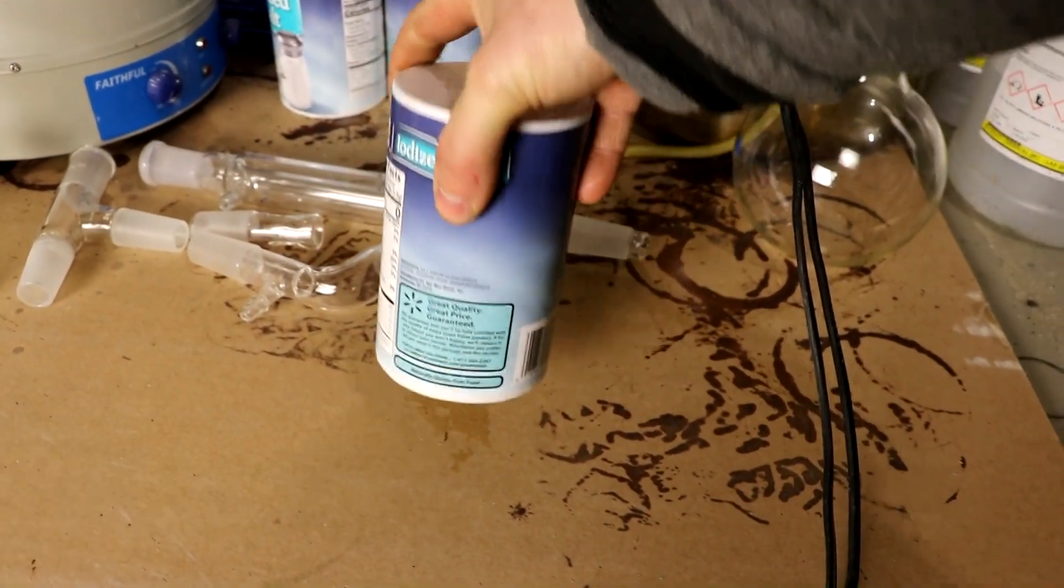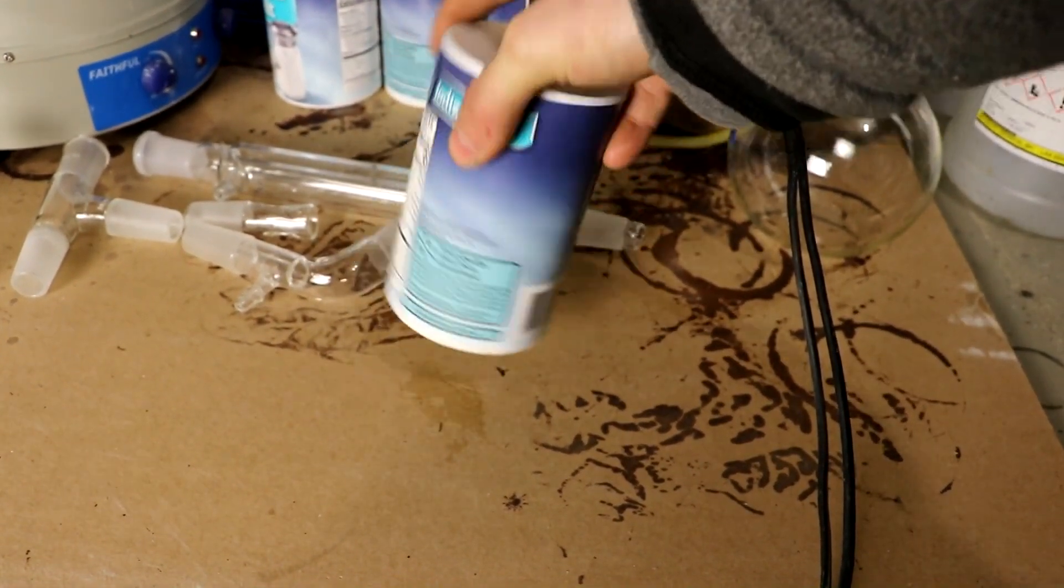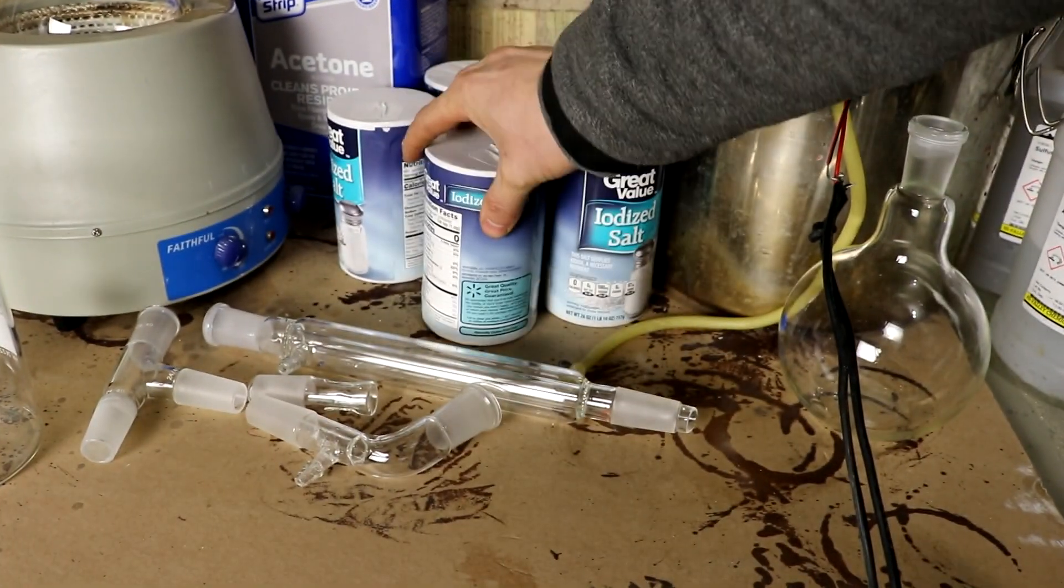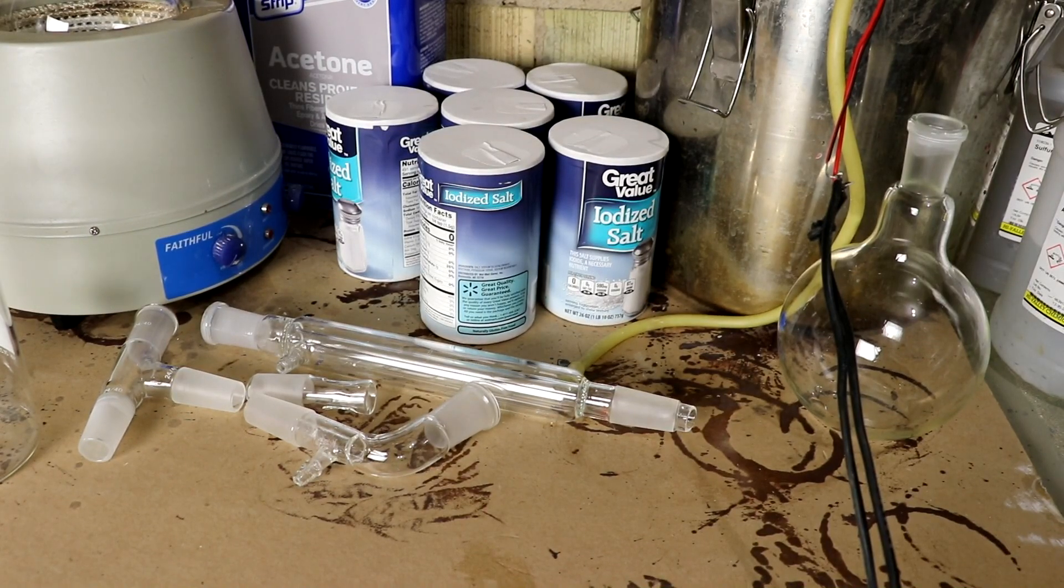I think I would just bake it in an oven at 500 degrees centigrade to decompose the iodate into iodide. You know, this is kind of like math. Convert into a form that you've already solved, or that you know how to solve, right?